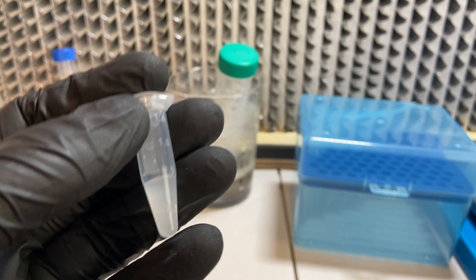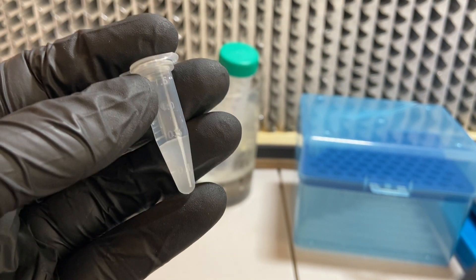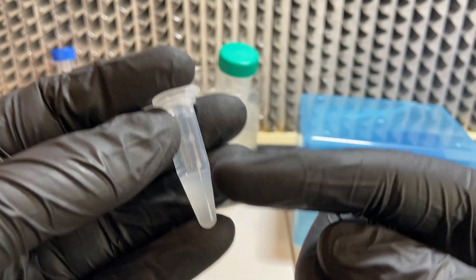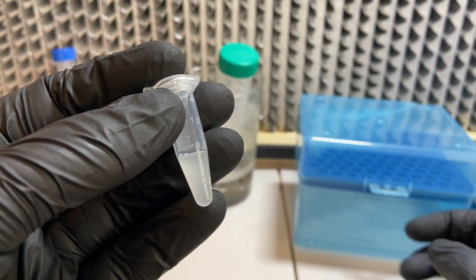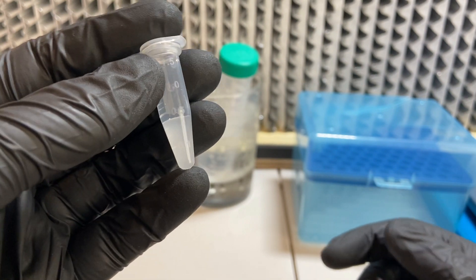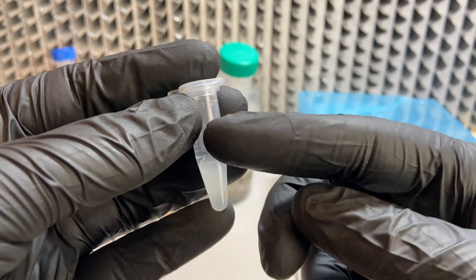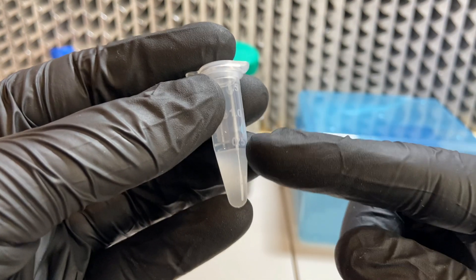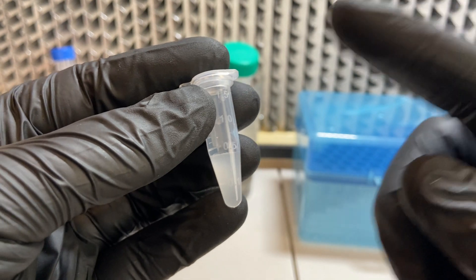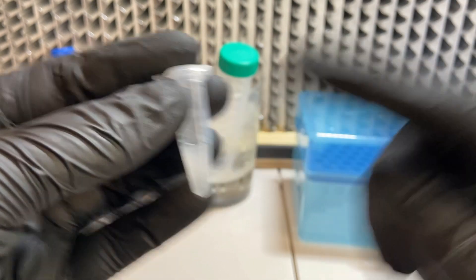If that works, we can talk about moving on to using DNA. One thing I'm not testing right now is whether shocking keeps the cells alive — I've done it so many times that even when it goes wrong some cells still live. So I'm going to save the materials and time for when we start to use DNA. Let's take this over to the electroporation machine, prepare the cuvettes, and give them a go.